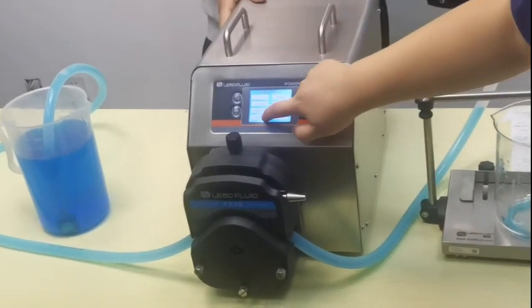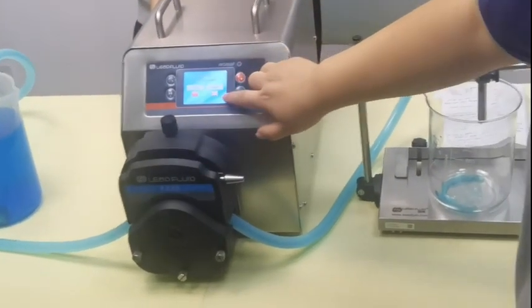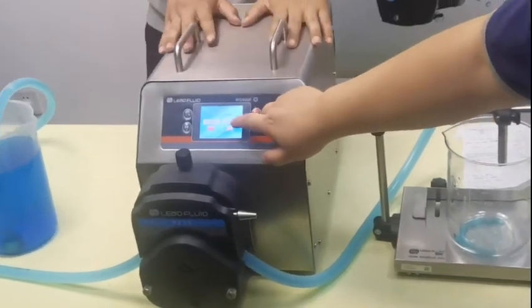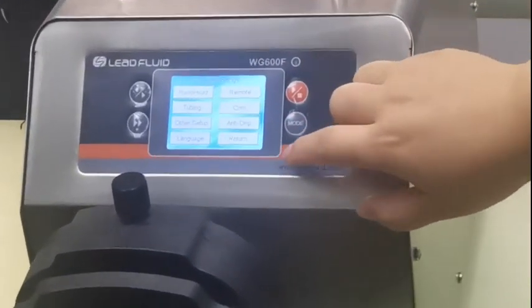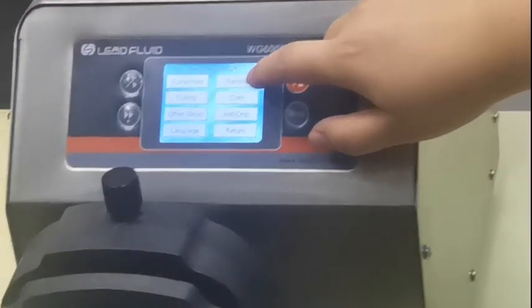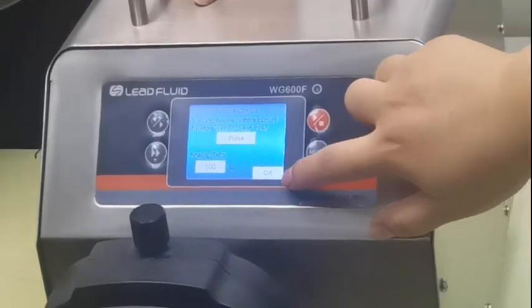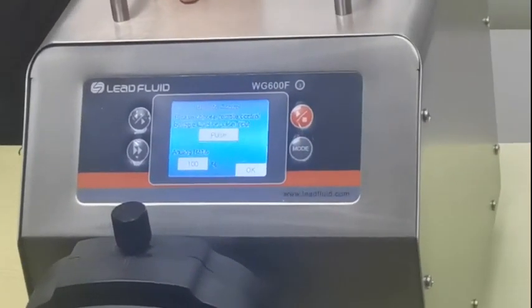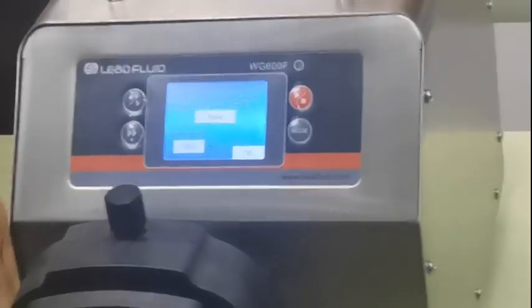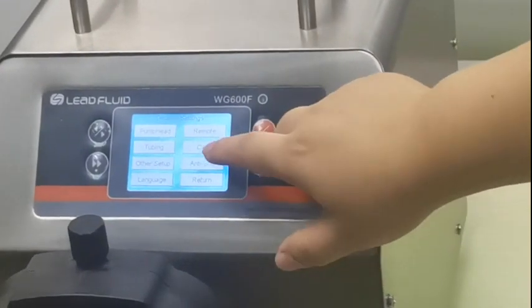Other setup options include language — Chinese and English. We are currently using English. There is also a remote control setting, which you can use if you want to control the pump from another machine.